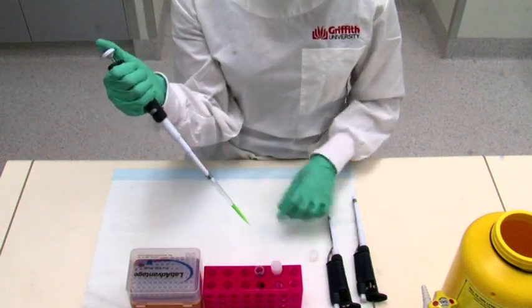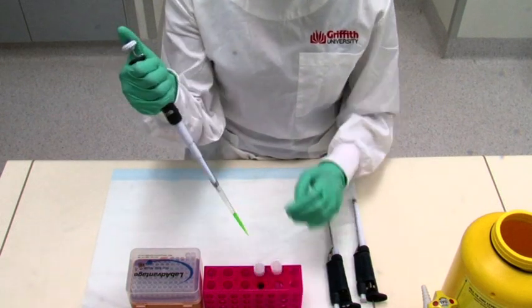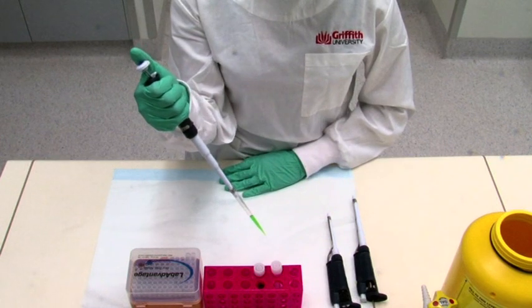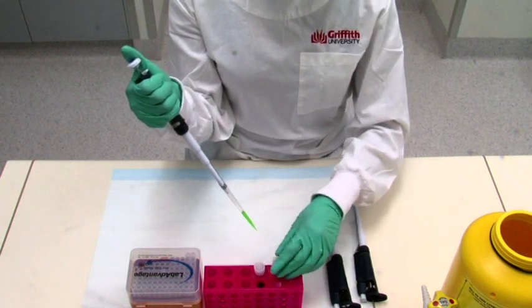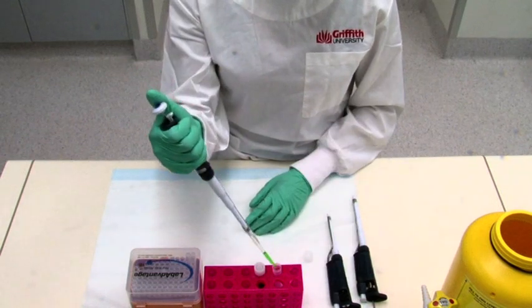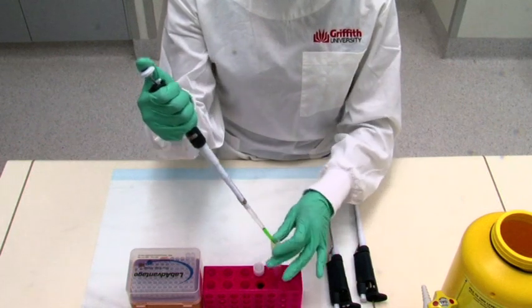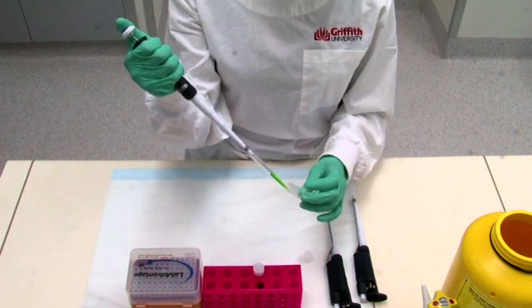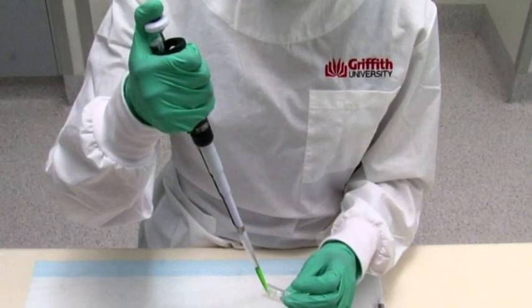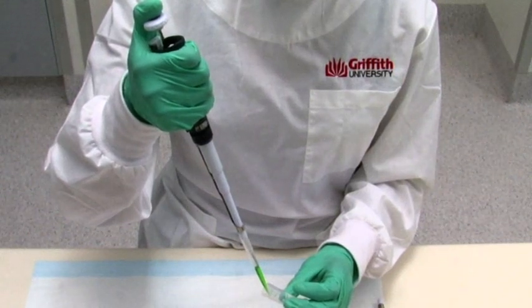Raise the pipette tip out of the solution, being careful to keep the pipette in a slightly tilted from vertical position. Put the lid back on the stock solution. Remove the lid from the tube that you will pipette the solution into and put the lid on the bench and pick up this tube and tilt it slightly. Now to deliver the solution drawn up into the pipetter, place the pipetter into the tube and touch the tip onto the side of the tube.